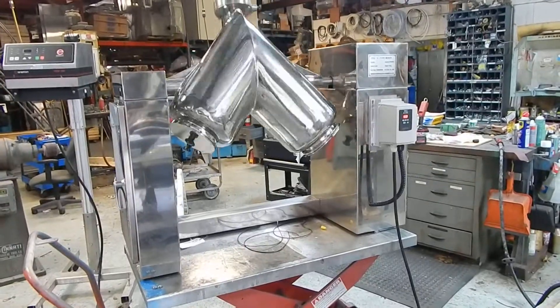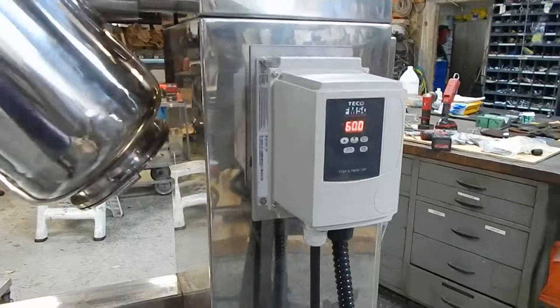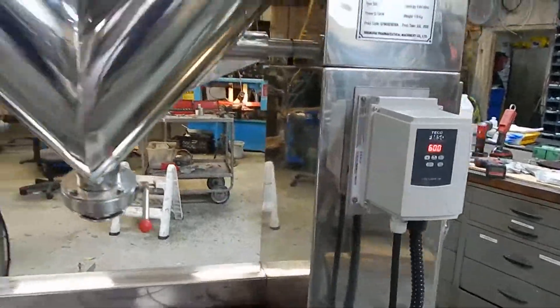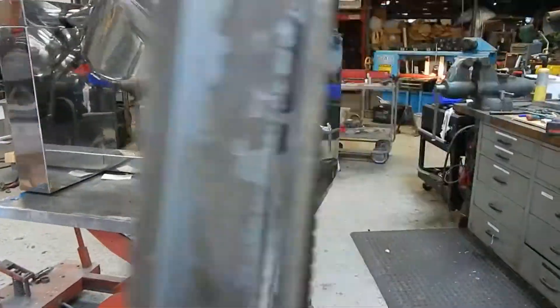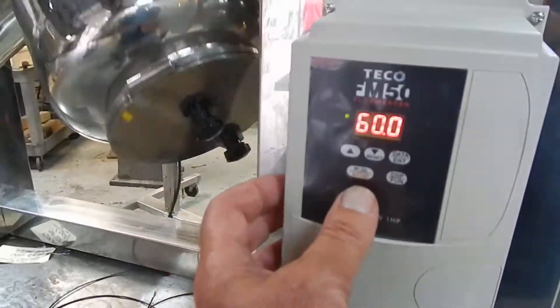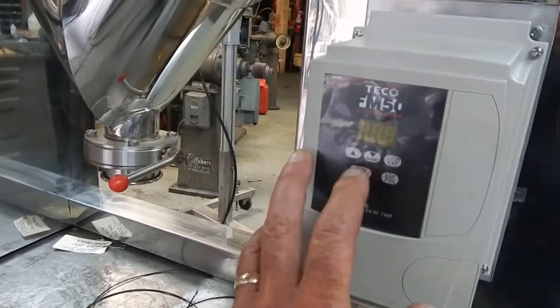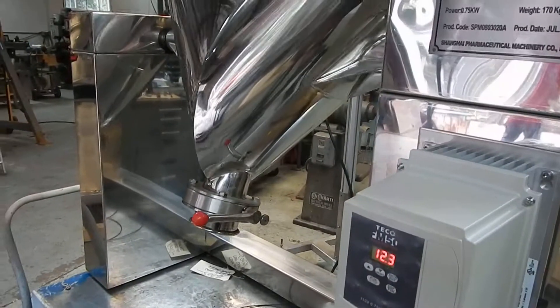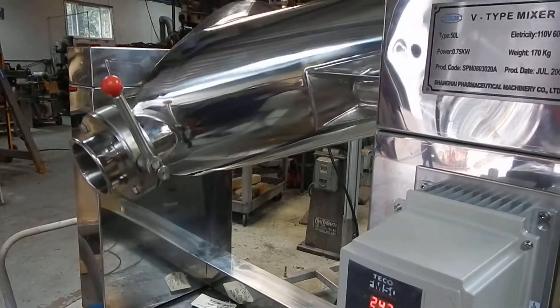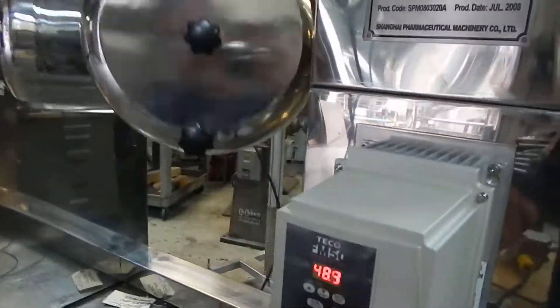To make it easier, like most AC frequency controllers, they'll have a braking feature in them. Let me come around here and just show you real quick. When you go to stop, you can almost select the point, and we've made it so it stops at the maximum amount of braking. So you can hit your target if you're emptying into a pail or loading for whatever reason.